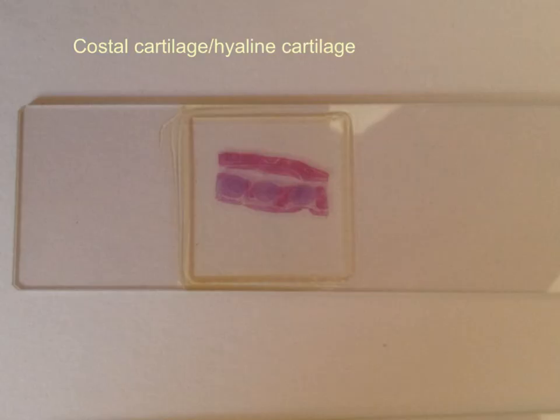This is the slide of the costal cartilage or hyaline cartilage, characterized by its specific shape. It looks like an eyeglass when it is formed of two pieces of cartilage surrounded by the red intercostal muscle. But sometimes you will have on the slide just three pieces of cartilage, so don't be astonished when you see three pieces. And also sometimes you will see one piece only of cartilage.